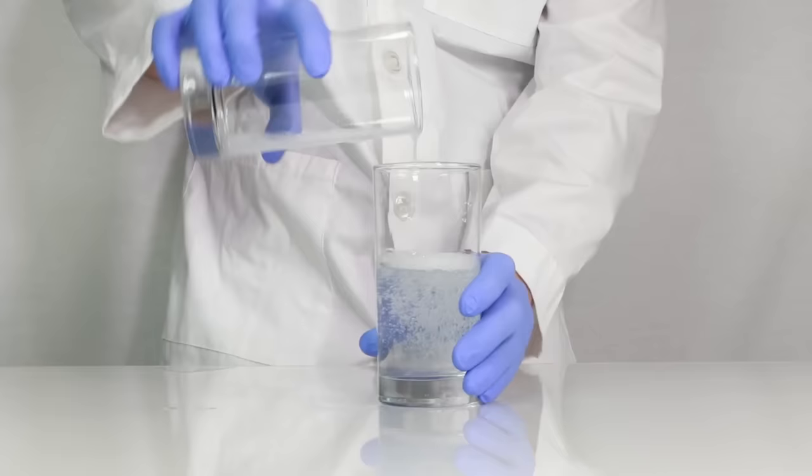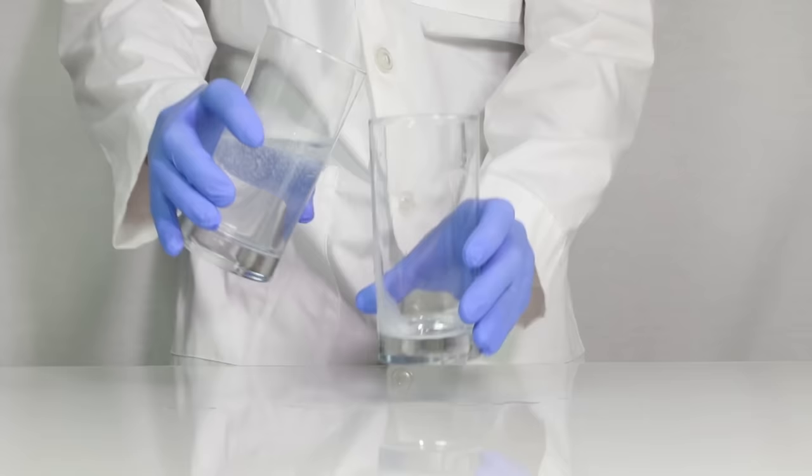A couple of tips just in case your color change is happening slowly: make sure that everything is dissolved really well and also heat up the solutions.